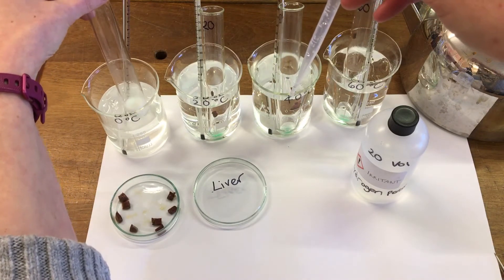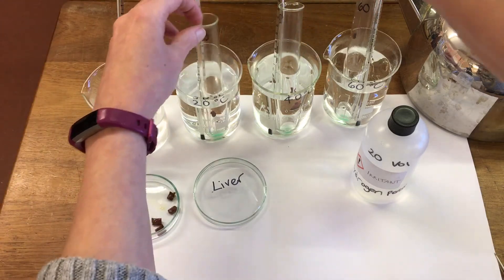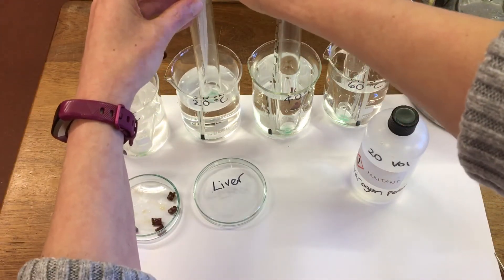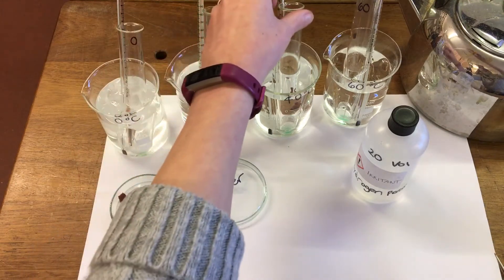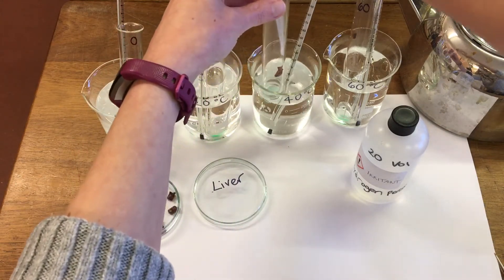We can see the reaction has started. Just make sure the liver is at the bottom of the tube.